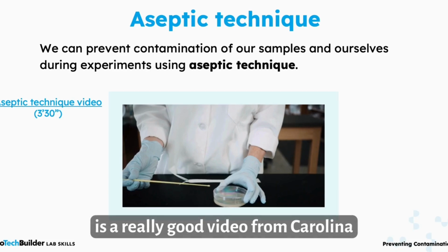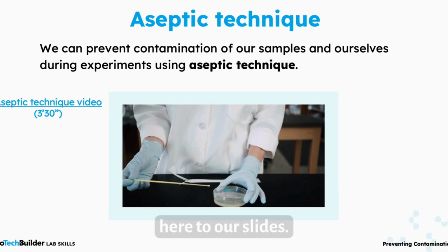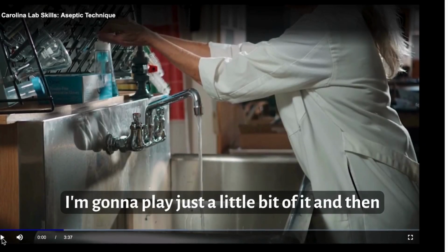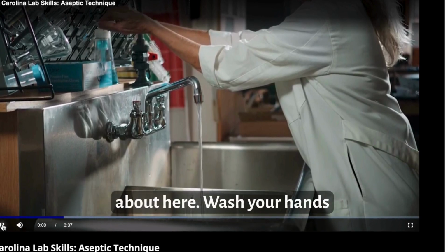There is a really good video from Carolina Biological Supply Company that is connected here to our slides. I'm going to play just a little bit of it, and then we're going to go into the lab to demonstrate some of what they're talking about here.